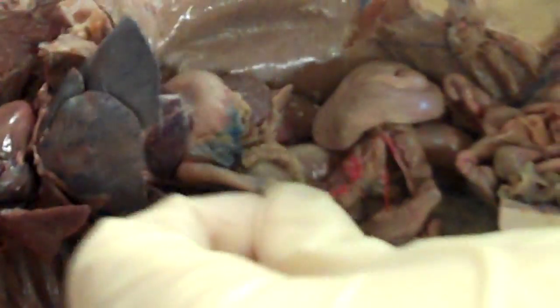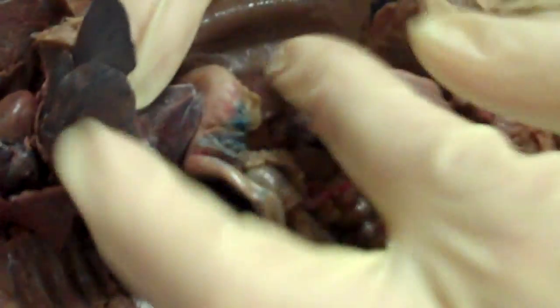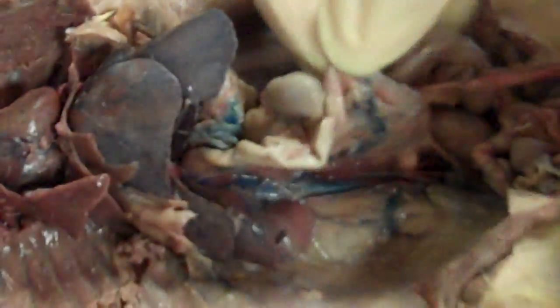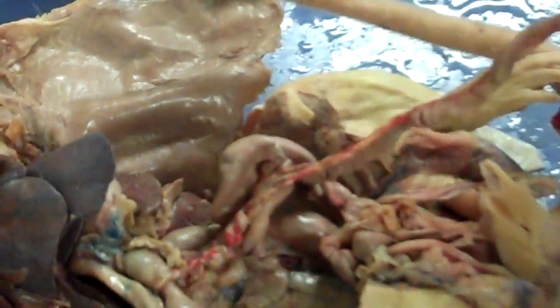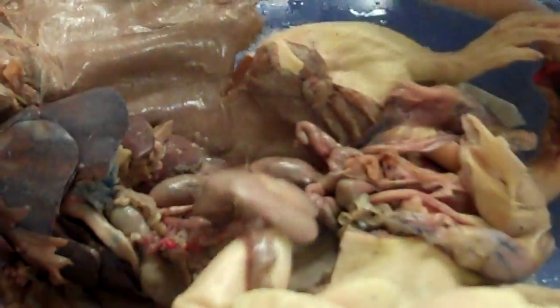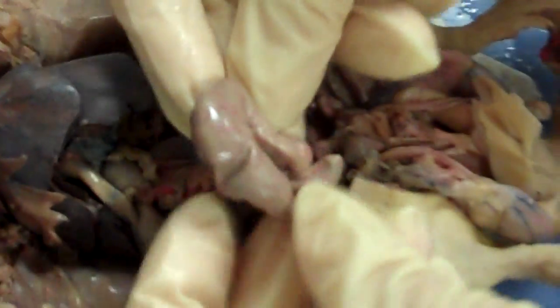Where the stomach and the small intestine meet, you find the pancreas. It has a bluish color here, though it's usually more brownish. This is all your small intestine — you have to know the parts in order. The beginning of the small intestine is the duodenum, which leads to the jejunum, and then the ileum is the last part. The ileum ends at the cecum, this big pouch that's equivalent to our appendix.